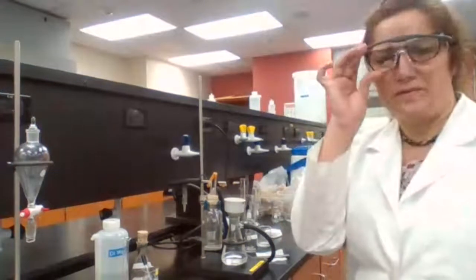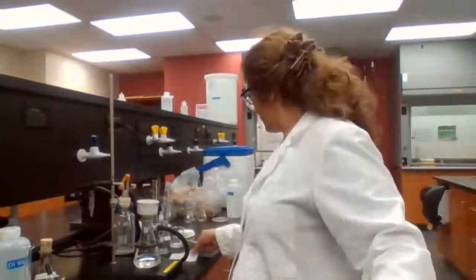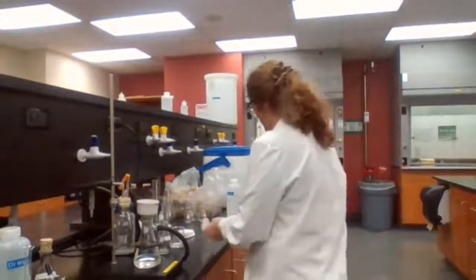So we count 5 minutes in the oven. Melting point of the benzoic acid and the dimethoxybenzene. Okay. We need the melting point for both compounds.